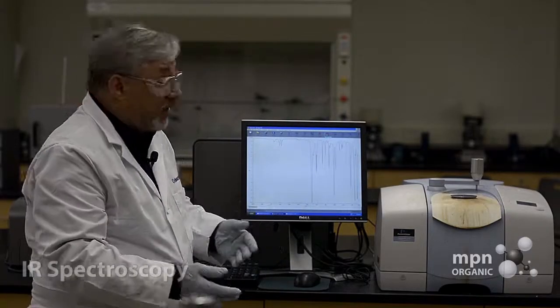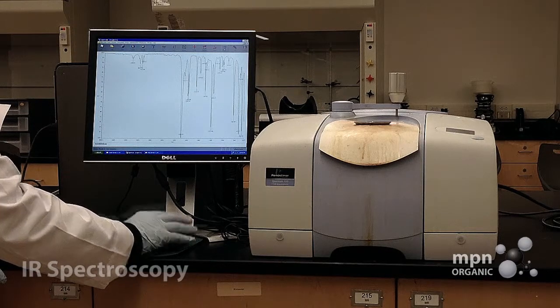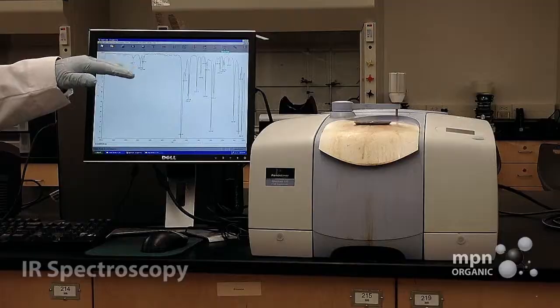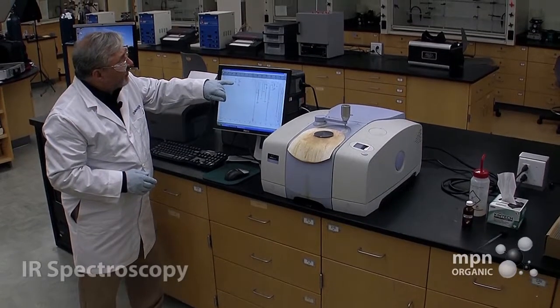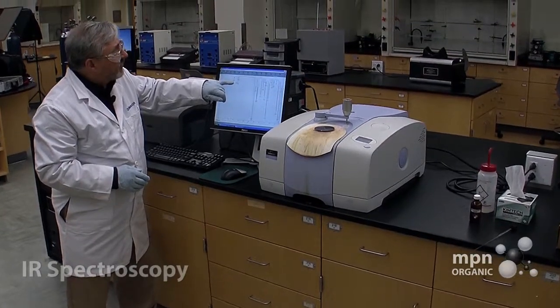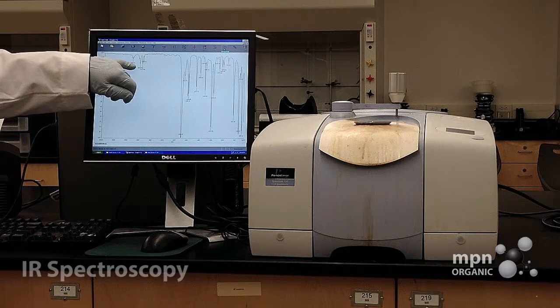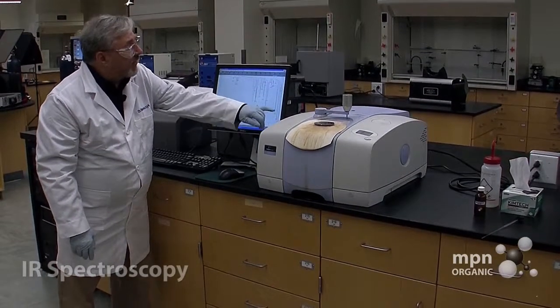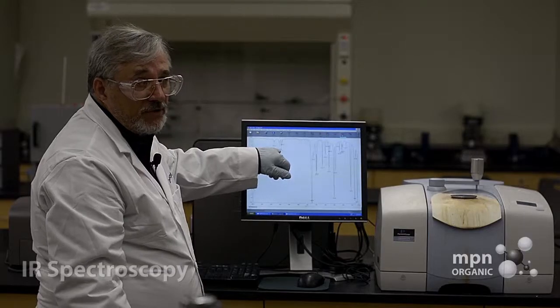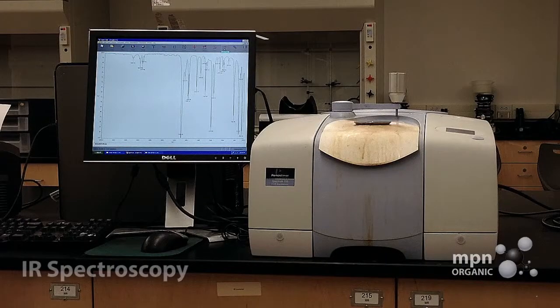It's important to know where they are. And so we're going to then click the peaks, and you can see that we have this set for a threshold where even small peaks like this one here at 3064 wave numbers is going to have a number associated with it. And so all of the important peaks now have numbers associated with them, and we can use this to identify benzaldehyde.